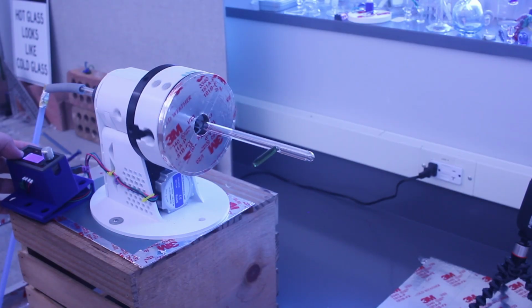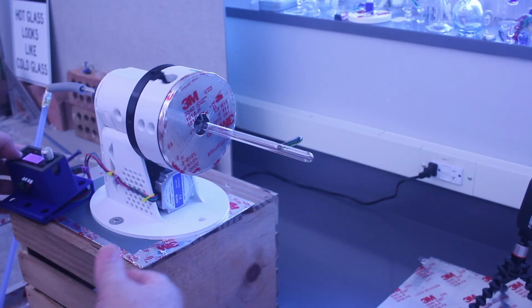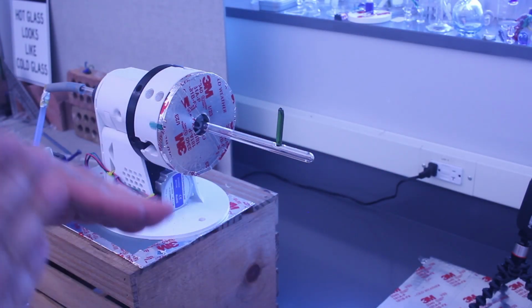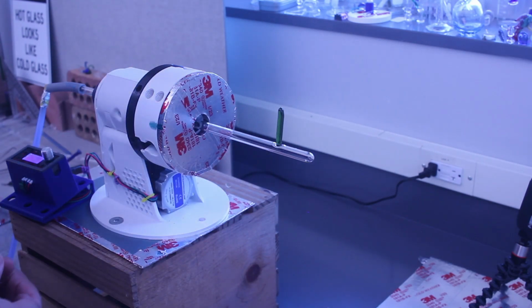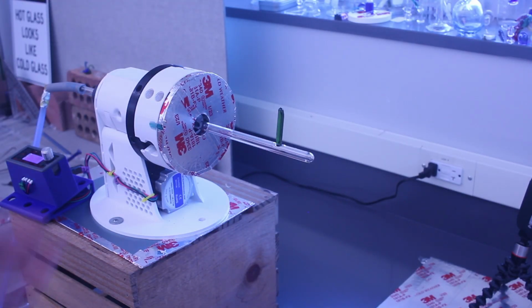Another nice thing of the lathe is by just taking it and letting it rotate, I get a really good view of the work at all the different angles, as it's going around. So if there was some gross non-uniformity, I'd be able to see it and deal with it. But overall, as far as seals go, that is, for me personally, a very good job. Usually when I make this kind of a seal, it might take me a little bit longer to clean it up. But this was, like I said, pretty straightforward. And as I mentioned again, you could go ahead and do other stuff at this point.